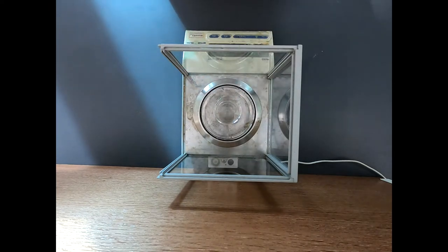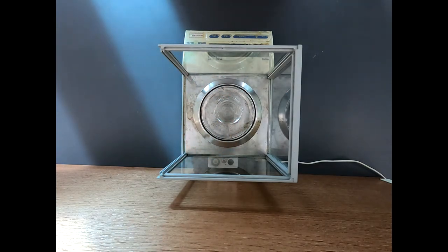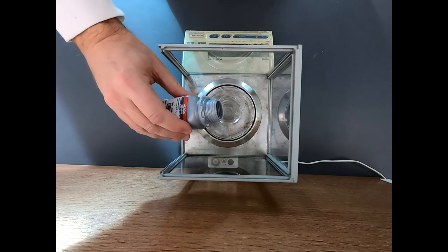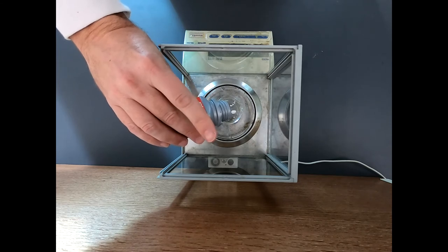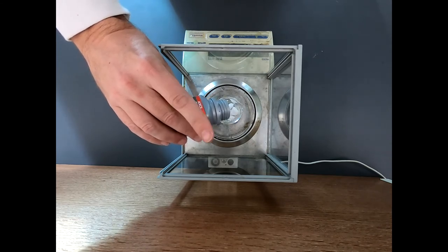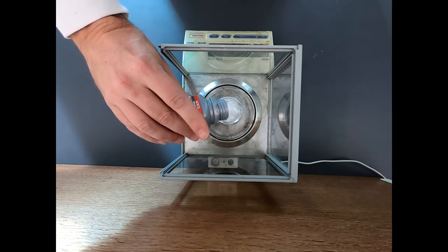And now let's go to our azide. This is sodium azide. Just as we use quite a bit of benzyl chloride, 20 grams, we're going to use quite a bit of sodium azide. We're going to use just over 12 grams. Now when I weigh out quantities like this, 12 grams, weighing paper doesn't cut it for 12 grams of material. I need something firmer. So very often I like to just get a glass beaker. And this is a solid, a white solid. So I'm going to open it up, and I'm just going to tap it out right into the beaker. We need a little over 12 grams. This reagent is going to be in excess, about a 20 percent excess. So this doesn't need to be exact. Again, I just want to get an amount and know exactly what I used.